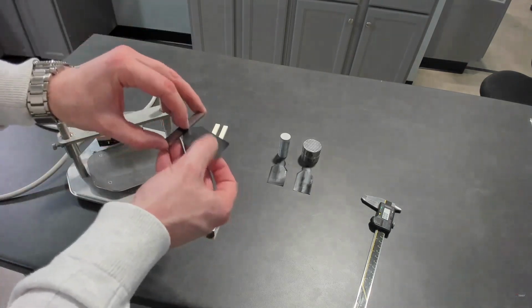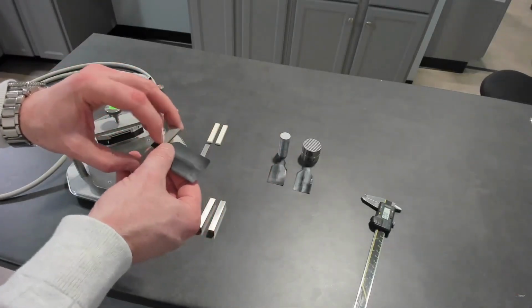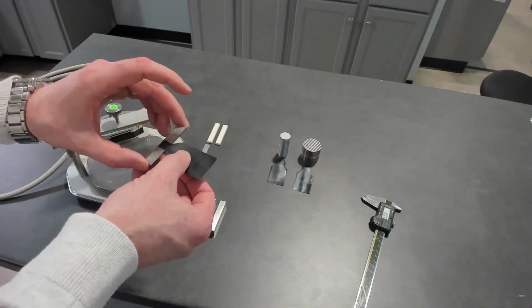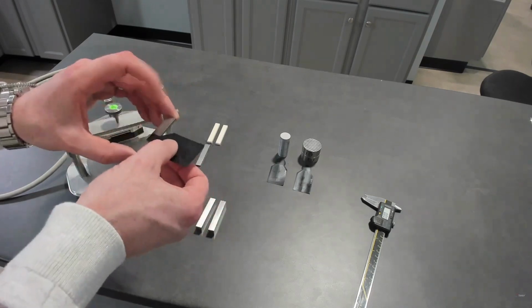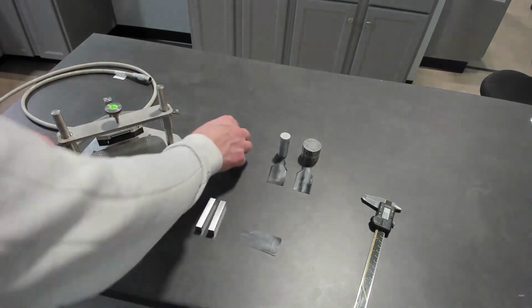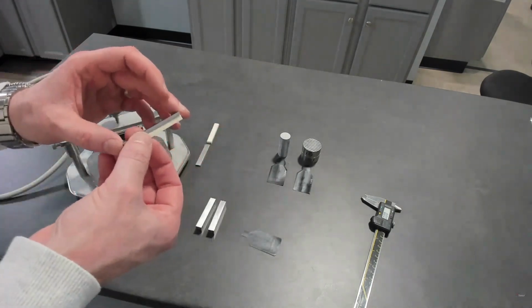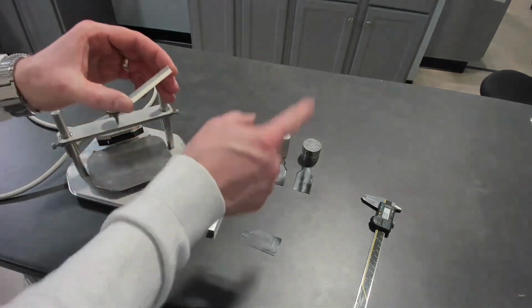But what we can run, just like the TPS method, is slab, where we can isolate the thickness and look at the heat propagation just along the in-plane direction. In that case, the sandwich is insulation. We put insulation on one side, just like transient plane source.